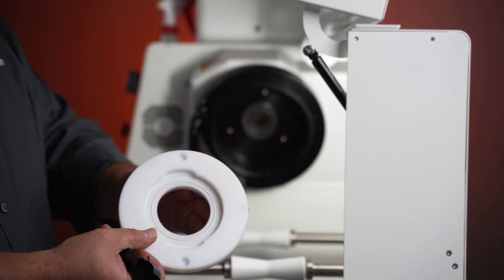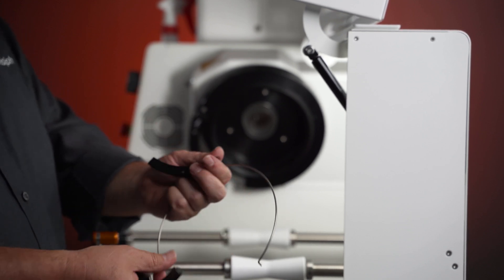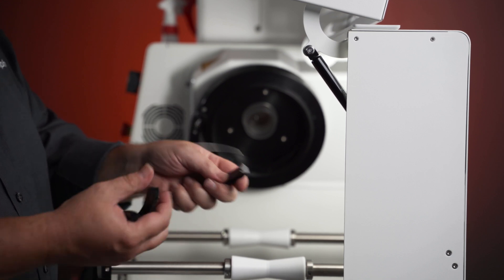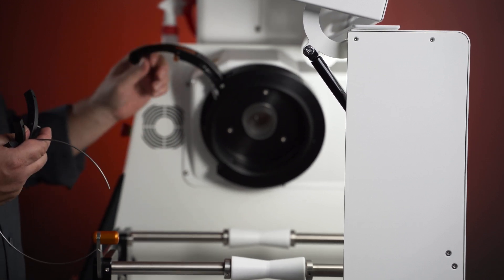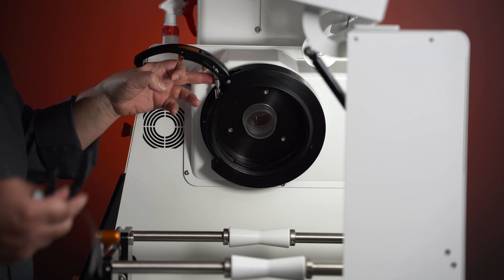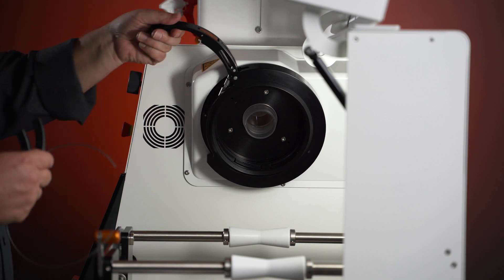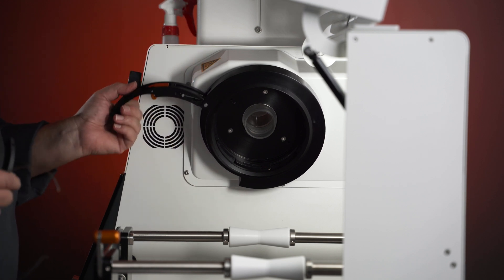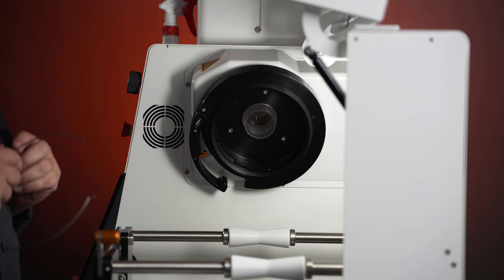The biggest thing is cleaning your guides and your spring, making sure they are free of any residue. The main reason we are very adamant about cleaning your collar is that if you do not clean it, you will eventually have issues opening and closing the collar, and this can also damage the adjusting bolt. This bolt adjusts the tension of your springs and guides to form a better seal with your evaporation flask and the rest of the glassware on the system. We don't want you in a position where you can't open or close it, because that risks breaking glassware — something we totally want to avoid.